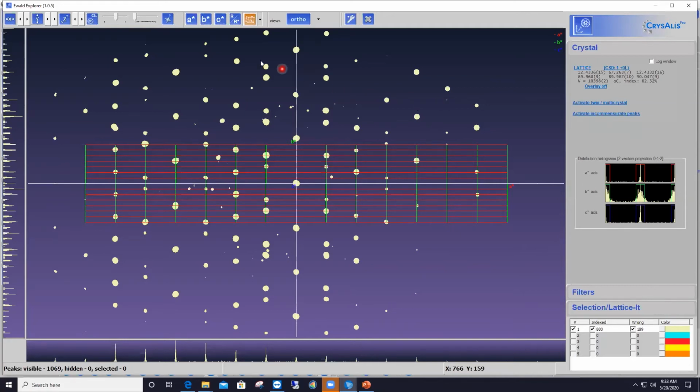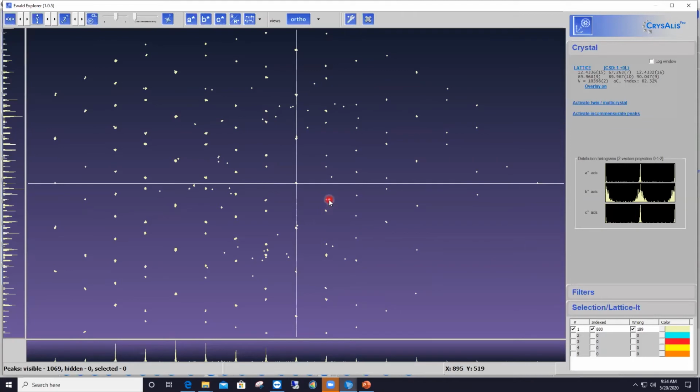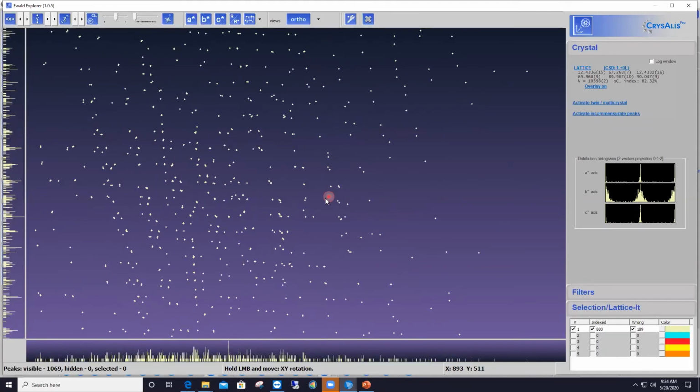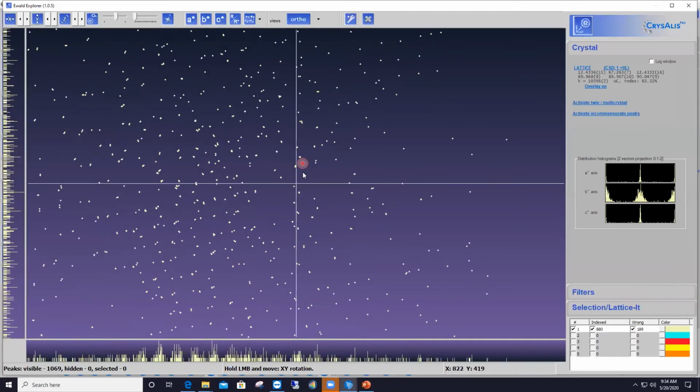To do that, I'm going to remove the lattice from the display by pushing this button here that shows the lattice, so that we're not distracted by it. And I will go back to showing the reflections as dots. So I'm going back to the GUI settings feature, and then I select again 3, which will display the reflections as a dot, basically with a scale factor of 3. And again, with the left mouse, by clicking and dragging, I'm going to rotate around until I see intertwined rows of reflections.